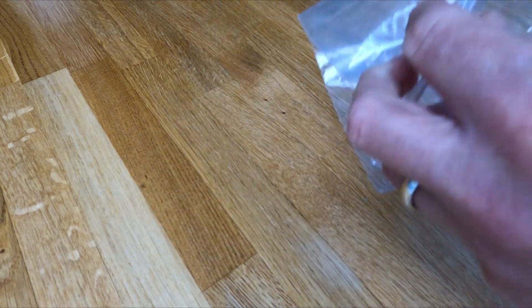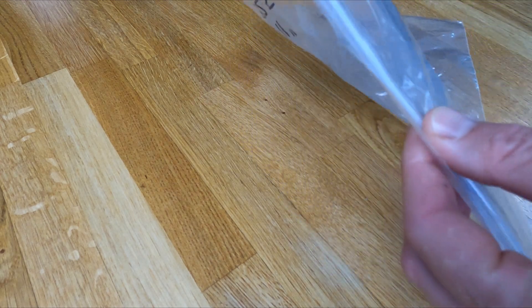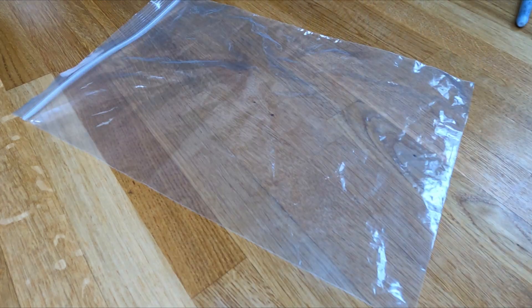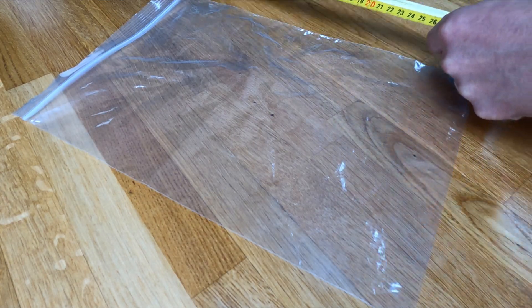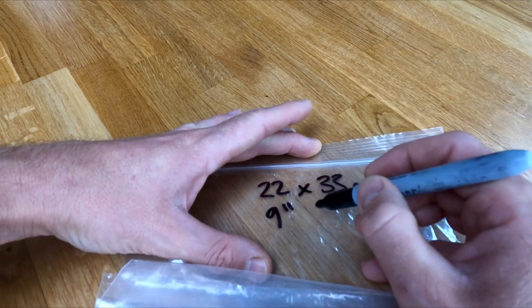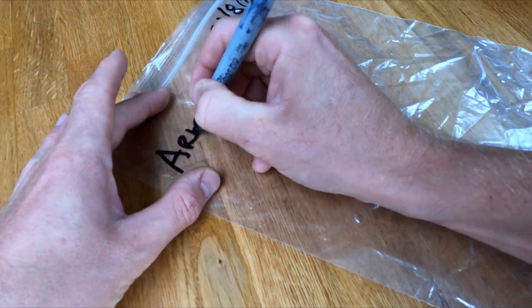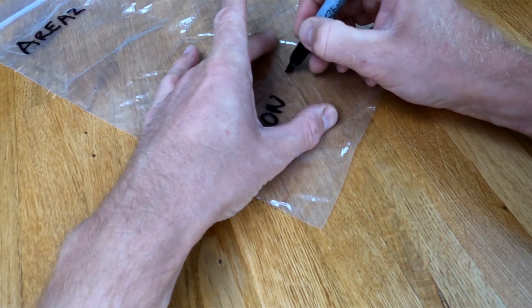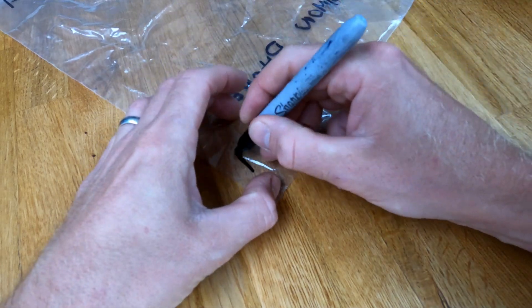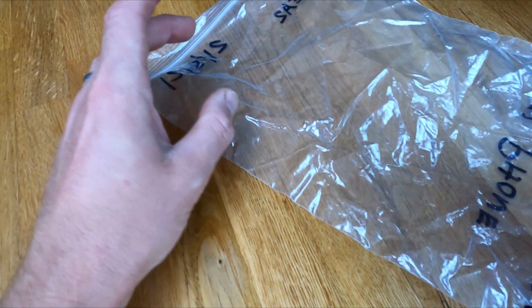Before you start you'll want some bags to put your samples into. I use the ziploc type — they're really robust, strong, and easy to close when your hands are cold and wet. They're large as well, which is useful. Nine by twelve inches is a typical size and I recommend trying not to go much smaller than that. Before I take them out into the field I'll mark them up with a sharpie pen — the date, the reference area, and my contact details. Pro tip: write the same information on the back of the bags as well, just in case something gets rubbed off during transport.